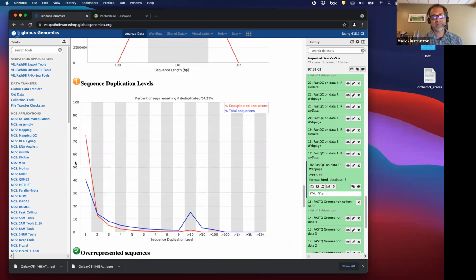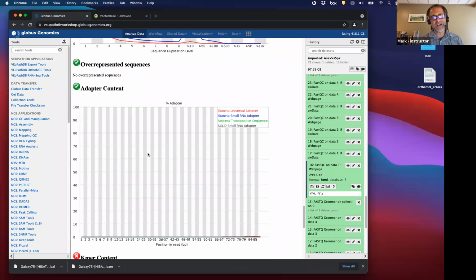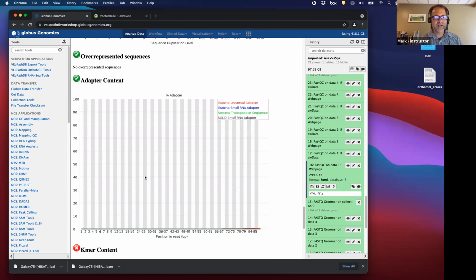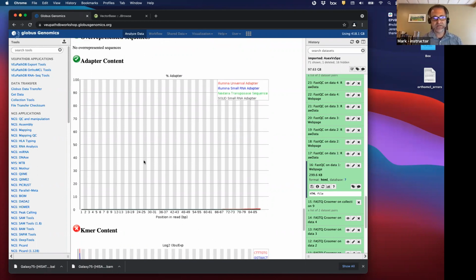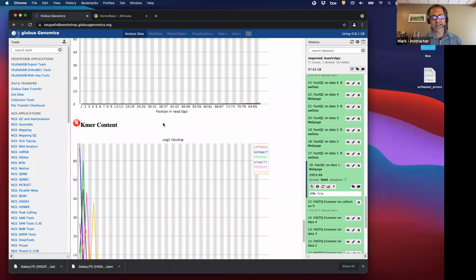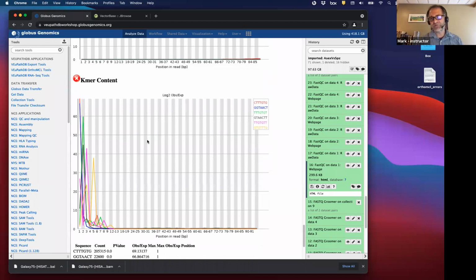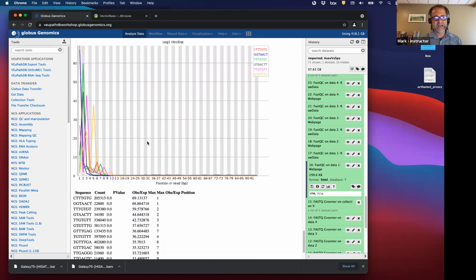Sequence duplication. This is actually pretty good. I'm not going to go into this, but I'm happy to talk about it more. Overrepresented sequences. A lot of times there are sequences that are not filtered out, like adapter sequences, RNAs, etc., and other contaminating sequences that are known to be there. These different algorithms look for those possible contaminating sequences. And there are a lot of tools in this FastQC package that look for repetitive sequences. But we're actually expecting to see a lot of repeats because it's RNA-seq data, and there are a lot of genes that are highly expressed. That means there are thousands of transcripts, and they're each sequenced many times.